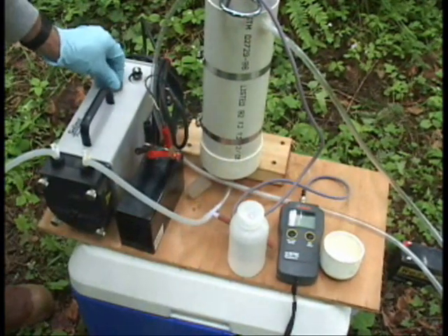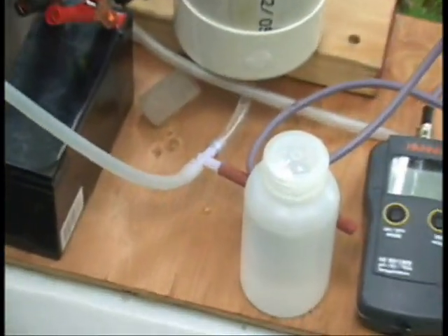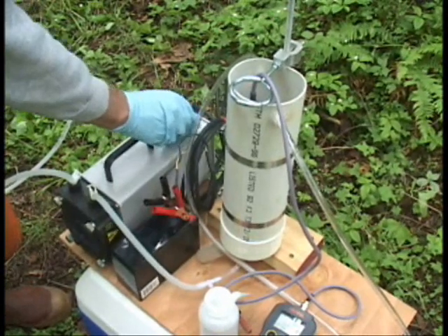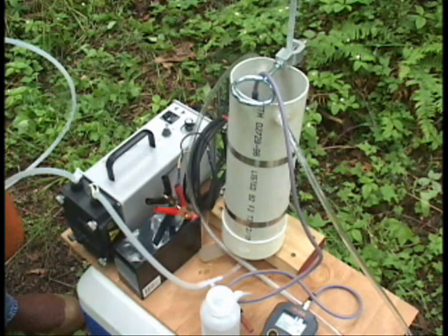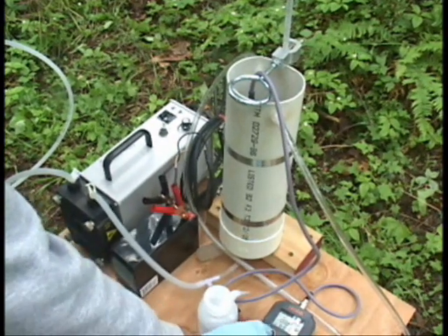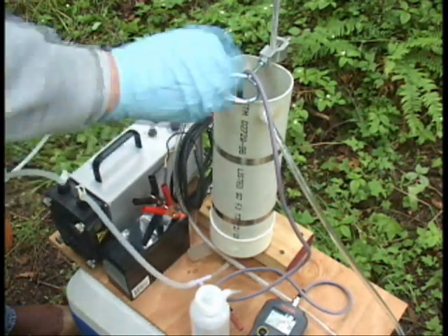We're going to start the discharge, fill up the flow cell, and then discharge to our bucket. We'll speed it up a little to fill the flow cell, then slow down to about a liter a minute when doing the first purge, and slow it down even more — down to about 100 to 200 milliliters per minute — when we're doing the sampling.